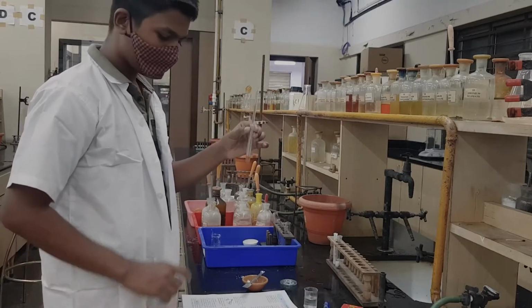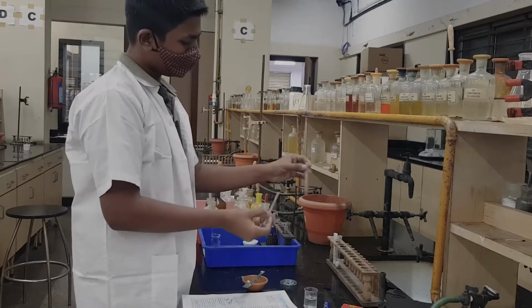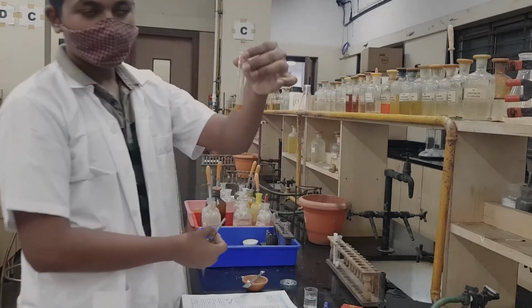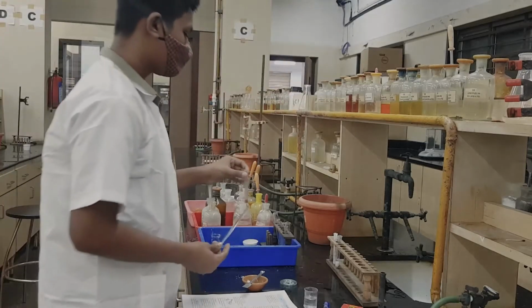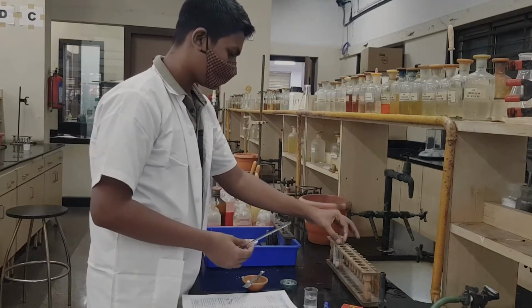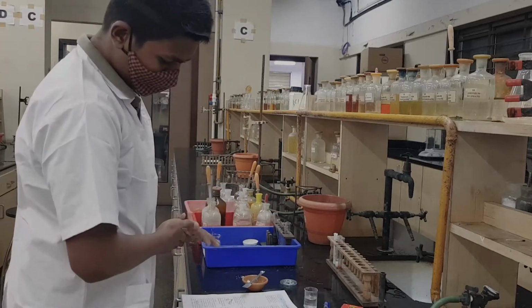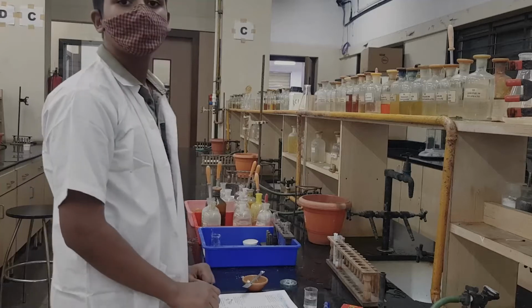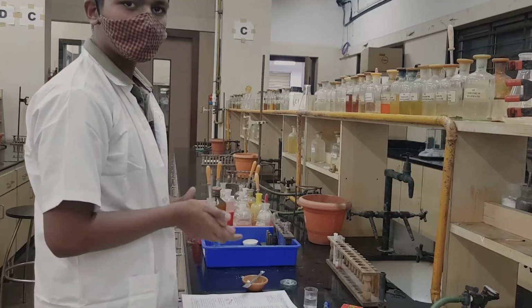You can see the brown precipitate; your solution has turned brown due to the presence of brown PPT, and this brown PPT shows ammonium is confirmed. So, your ammonium radical is confirmed by seeing a brown PPT with Nessler's reagent. We repeat this with another CT.